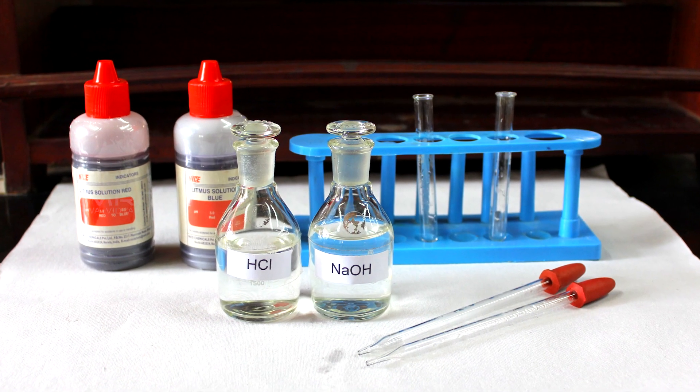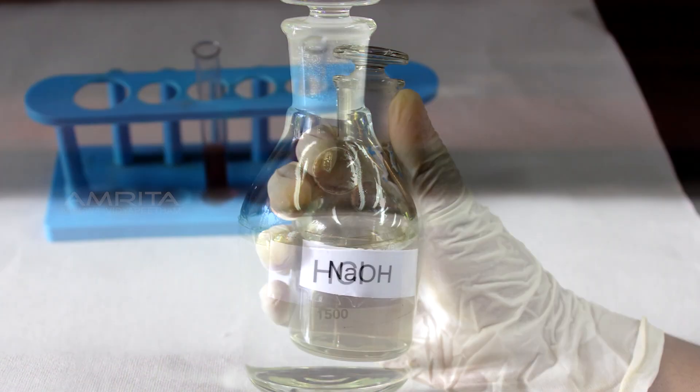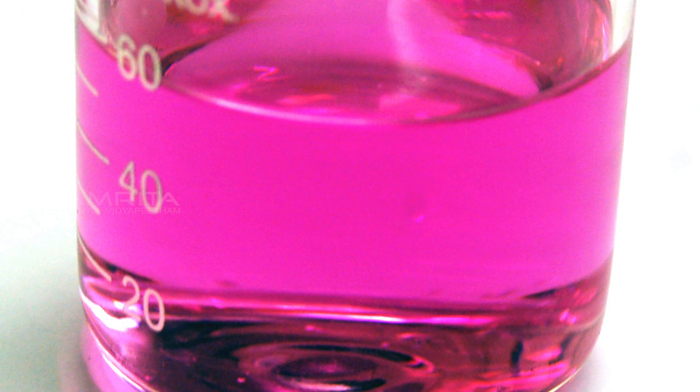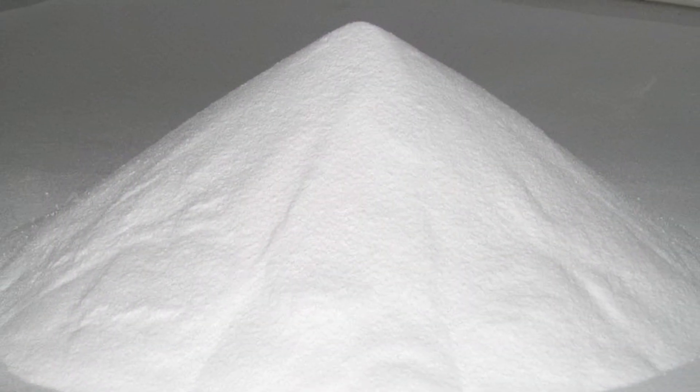In this experiment, our aim is to study the properties of acids and bases, HCl and NaOH, by their reaction with litmus solution and solid sodium carbonate.